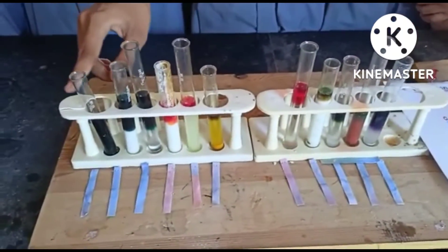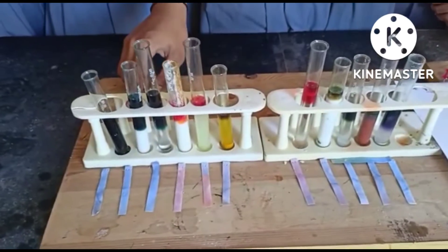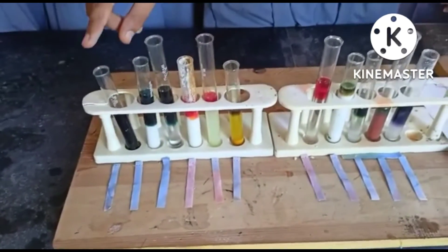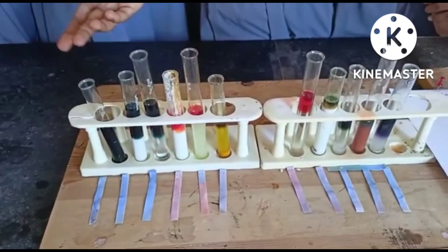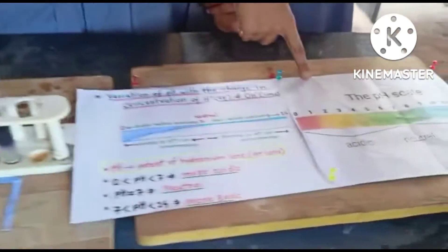After adding the universal indicator to all these solutions, we found that their color has changed. We matched these colors with the pH scale and found their pH levels.